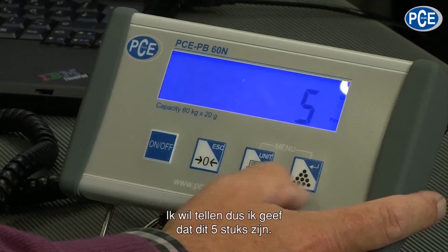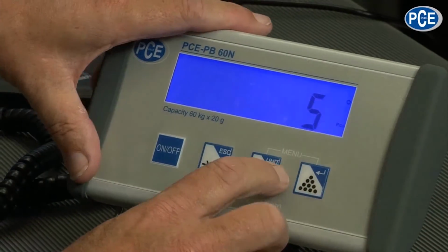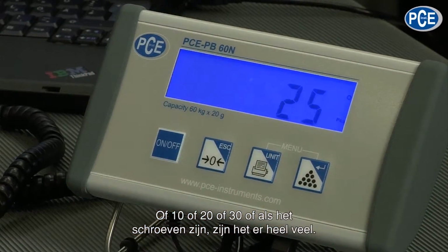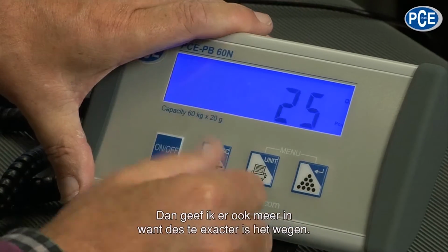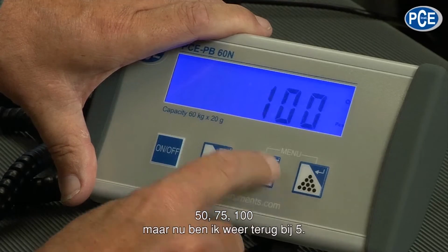And I have the possibility to say, we have now 5 pieces, or 10, or 20, or 30. When I have screws or other items and have lots of them, then I take more, and the weighing is then more exact: 50, 75, 100.